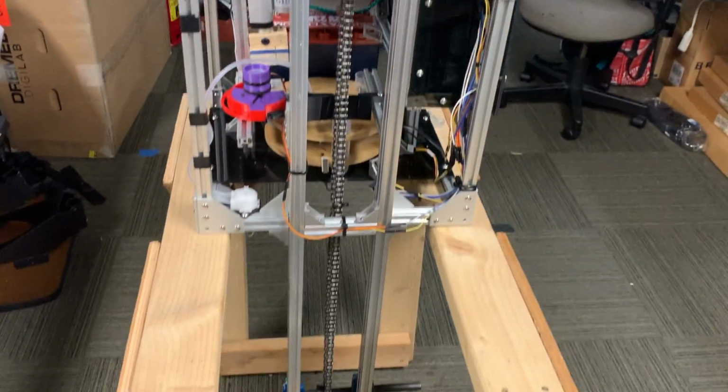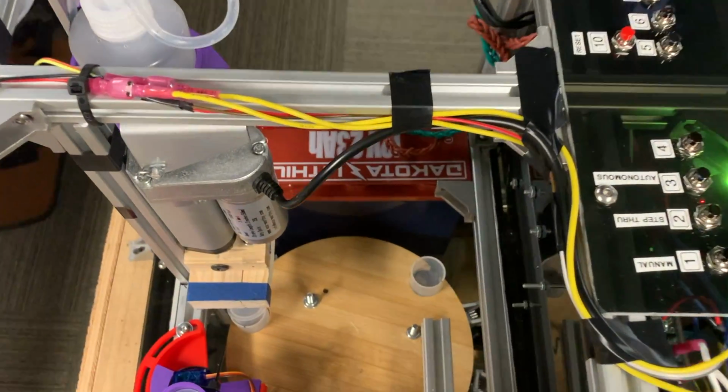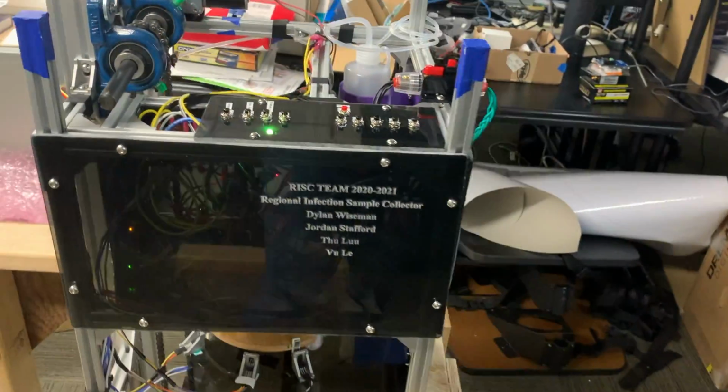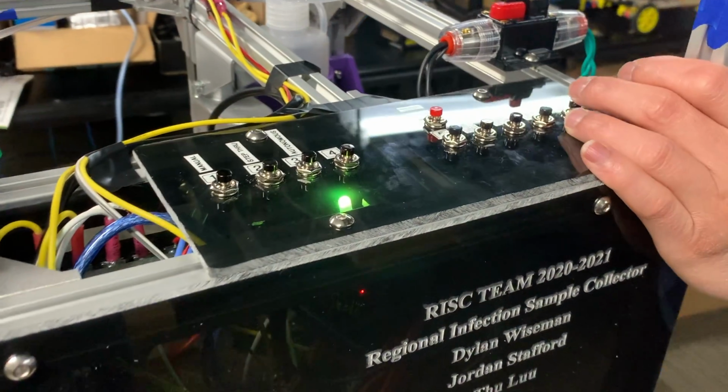and thus more frequently. The device that we have built is powered by a 12-volt, 23 amp-hour DC battery and is controlled by an Arduino Mega 2560 board. The device runs through a 4-stage process to complete the sample collection and is controlled by a set of buttons to navigate through the stages.